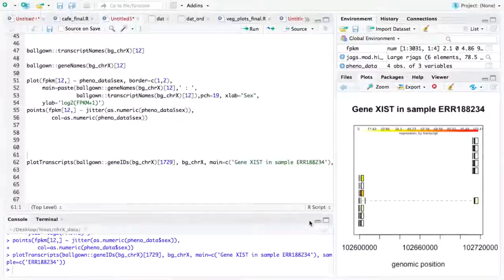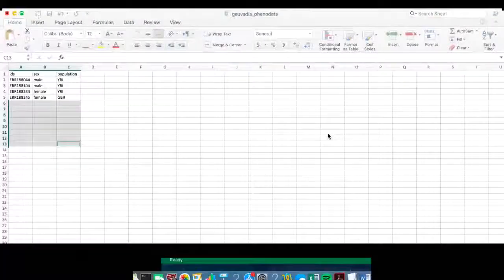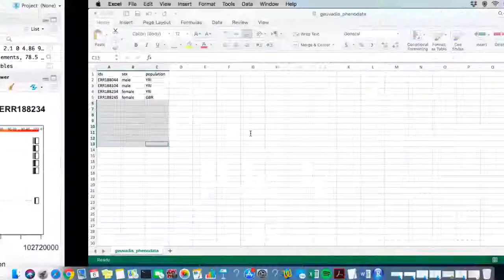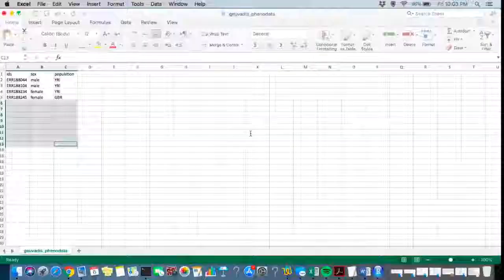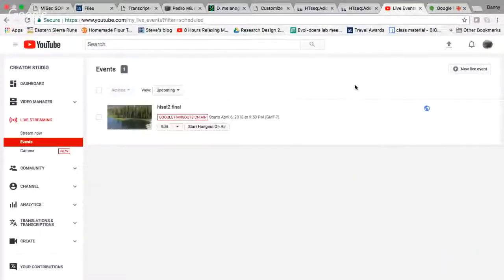It didn't quite work exactly, but there was an issue, like I said, with one of the files. Okay, well, that is the end of the HISAT protocol.